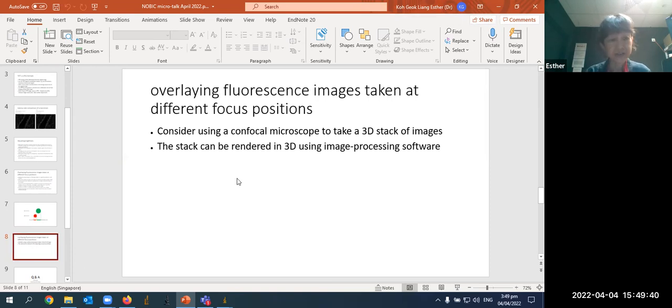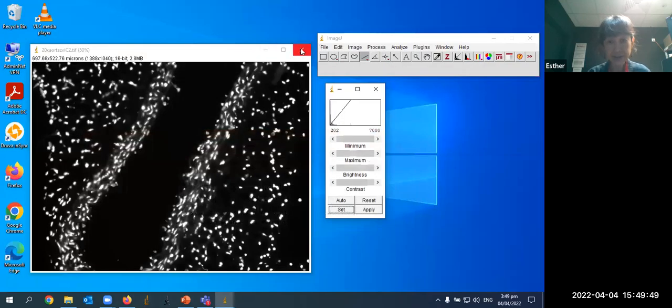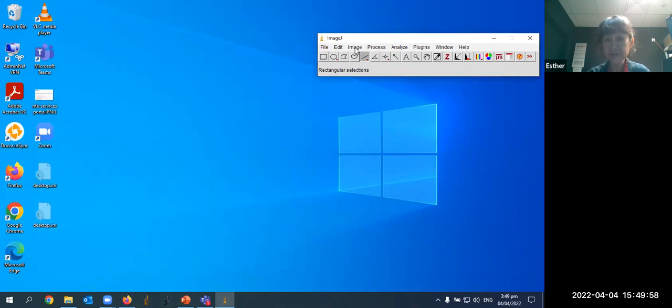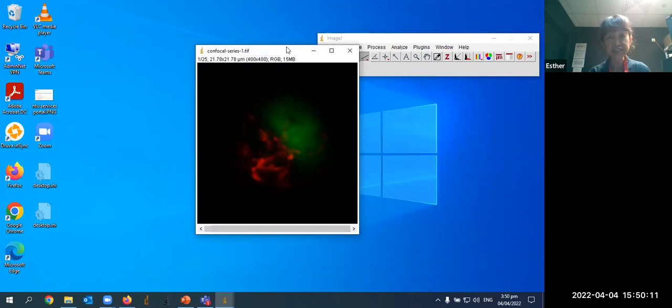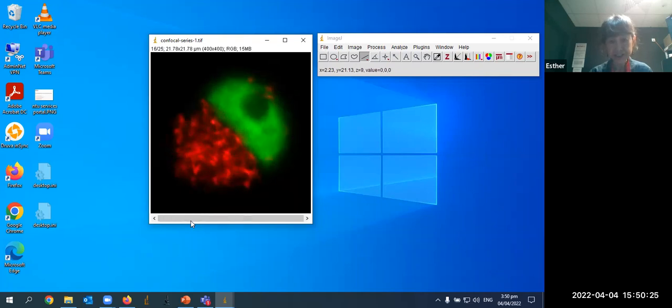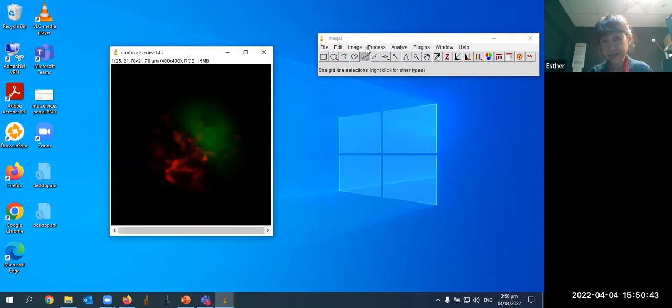So I'm going to just quickly do one example from ImageJ again. Here. I can close this one and this one. And let me open up a 3D stack, which I have prepared, is this one. Okay, so we have a 2-channel green and red image with 25 slices, 25 focal positions. Yes, so you can see that the structures change as you step through the different depths of the sample.